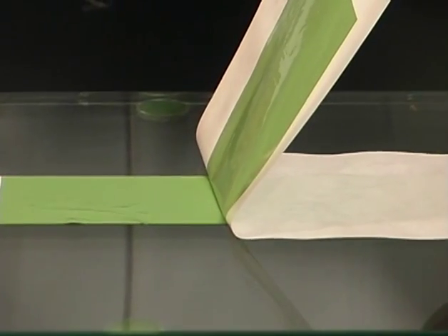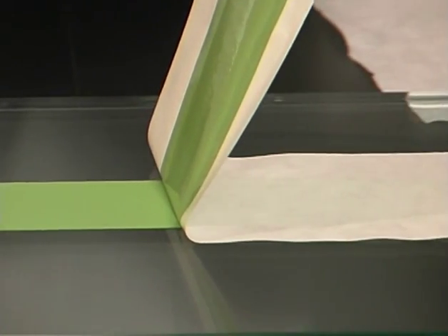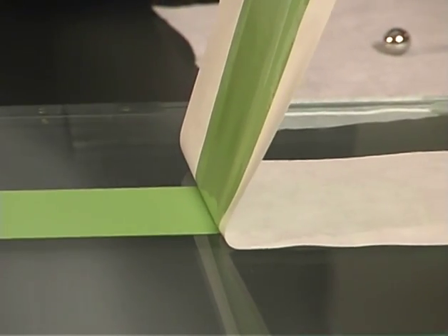Finally, peel off the liner and top layer of tape so that the original specimen layer is exposed.